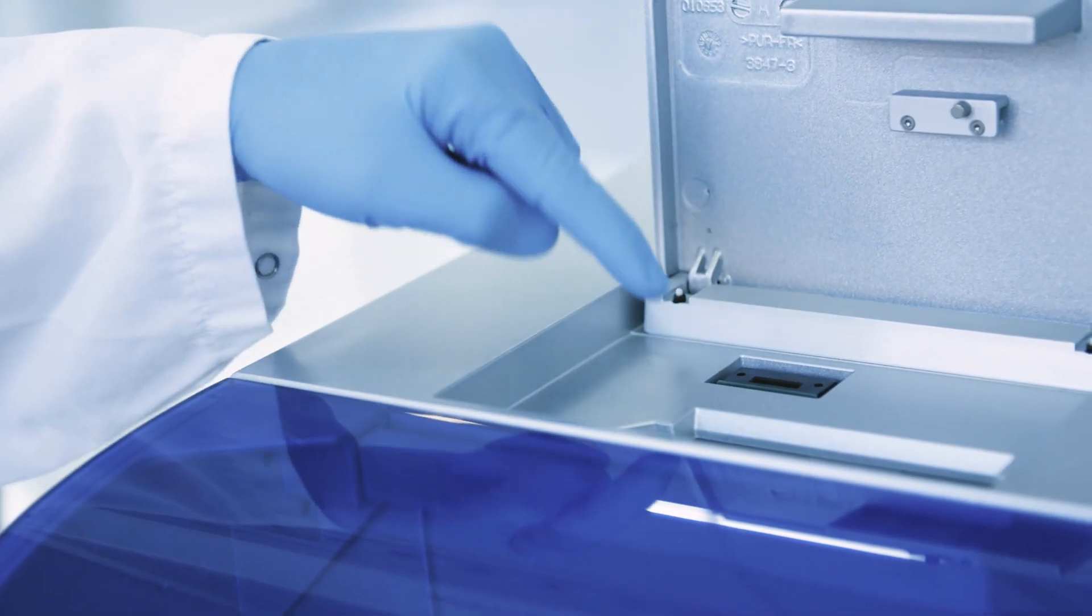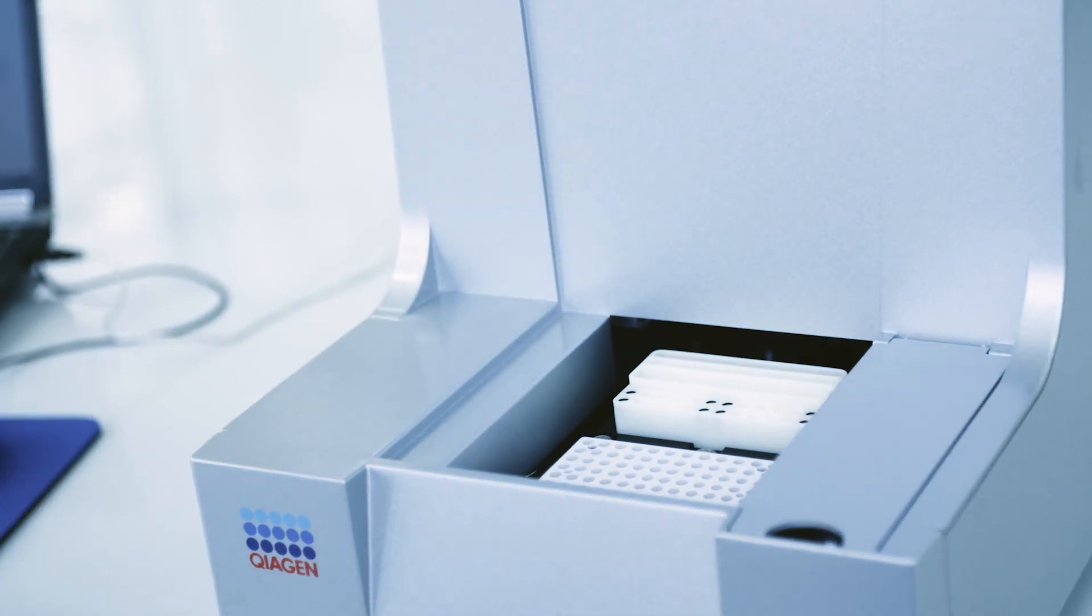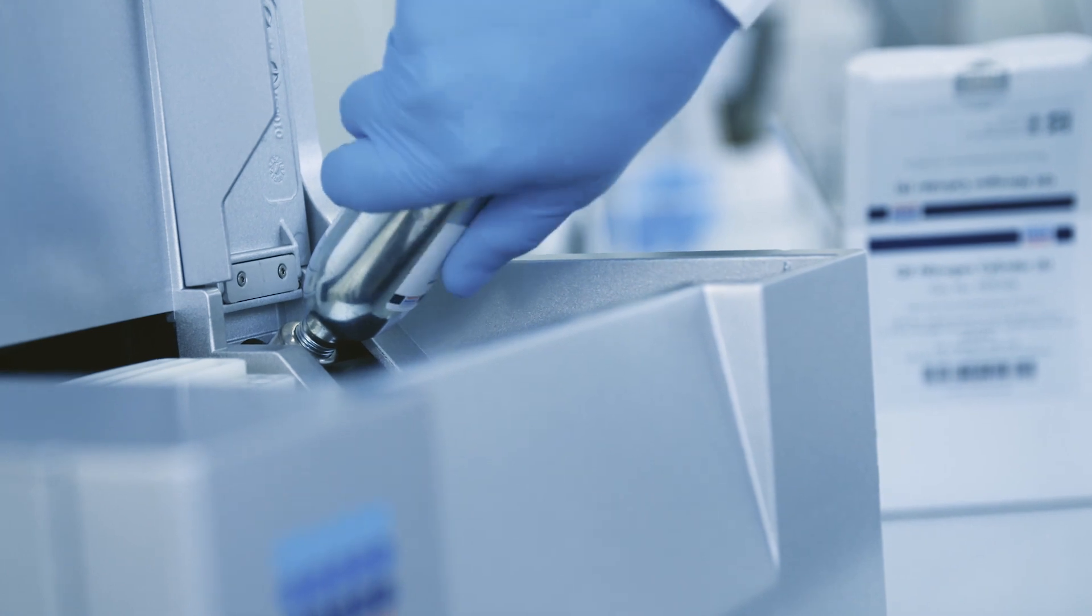Insert the QIAxcel cartridge and smart key. Load the samples and buffer tray onto the work table. Ensure that the QX nitrogen cylinder is fully tightened.